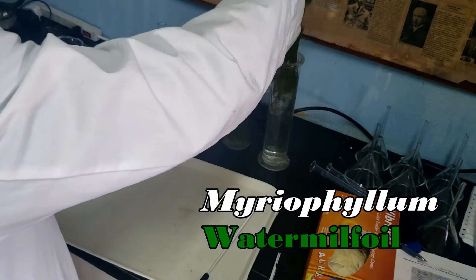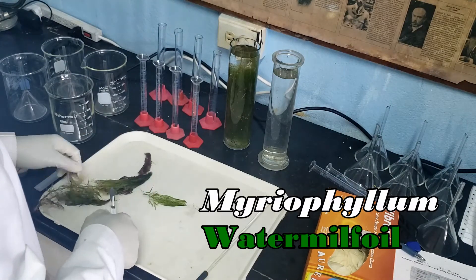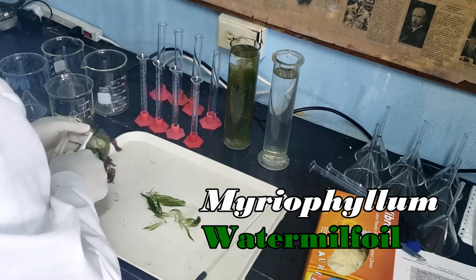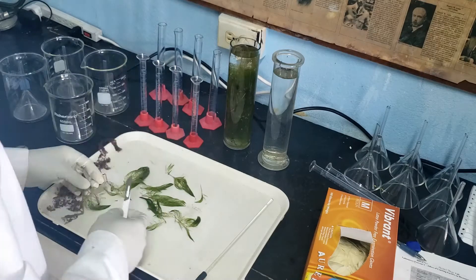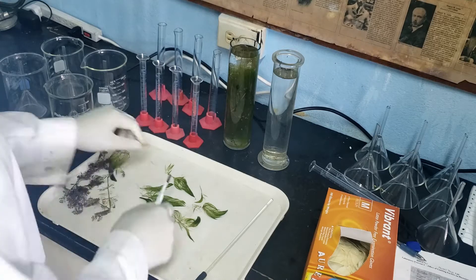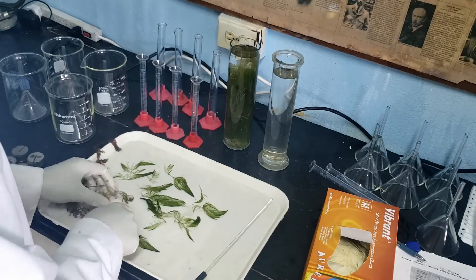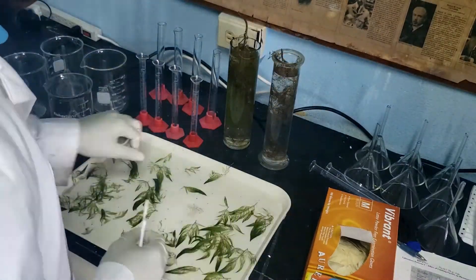The first thing we want to do in this experiment is to prepare our pondweed. The pondweed we found was a watermilfoil, which is commonly found in many ponds or stagnant water areas in Belize. The watermilfoil has wispy, feathery-like leaves growing in a whorl around the stem. We will prepare 16 stems from this pondweed with relatively the same number of leaves. Once those stems are prepared, we can go ahead and set up the apparatus.